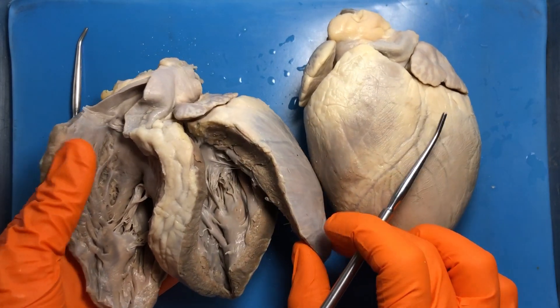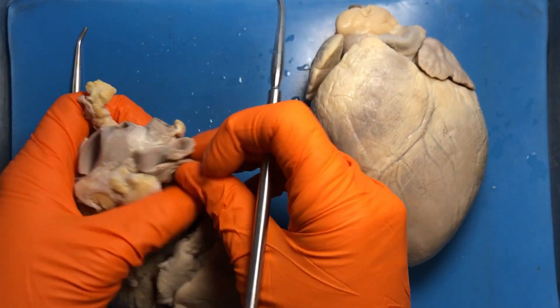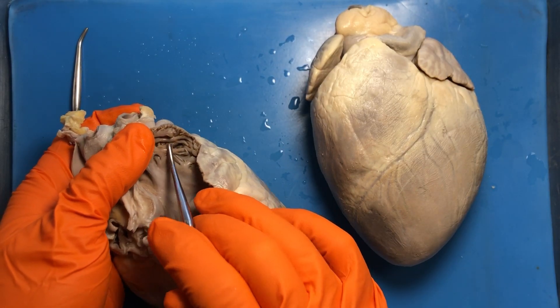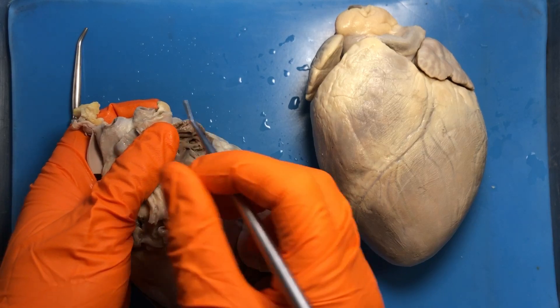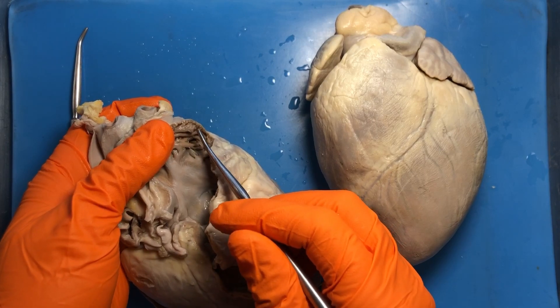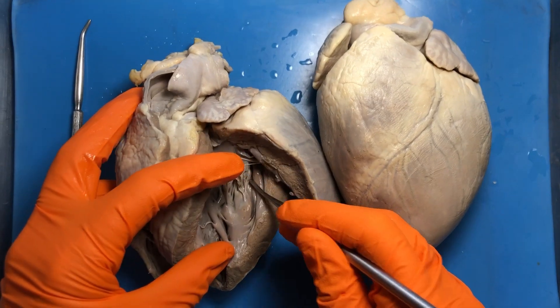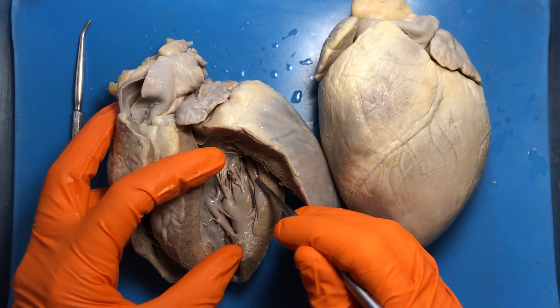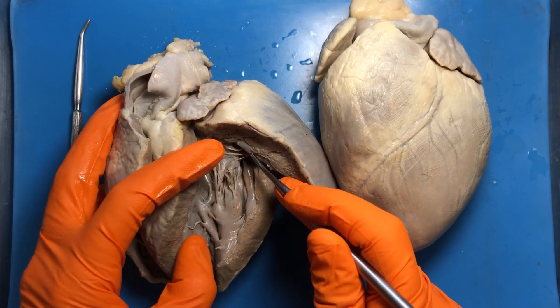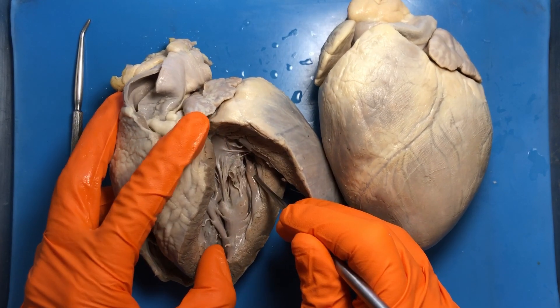Within the atria we have pectinate muscle — 'pectin' refers to comb-like, so it looks like someone ran a comb through it, which is indicative of the atria. In the ventricles we have deeper, wrinkly ridges called trabeculae carneae, which loosely translate to 'flesh beams' or 'meat columns.'